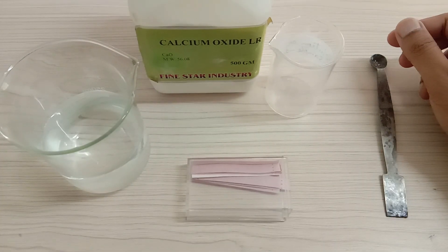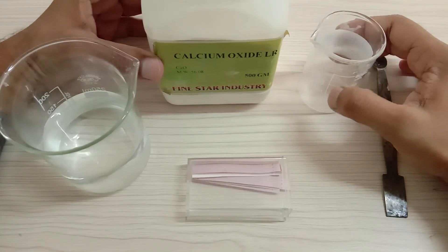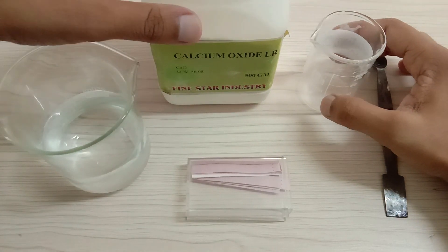Hello scientific audience, how are you all? Today I would be demonstrating the formation of calcium hydroxide, slaked lime, or lime water.